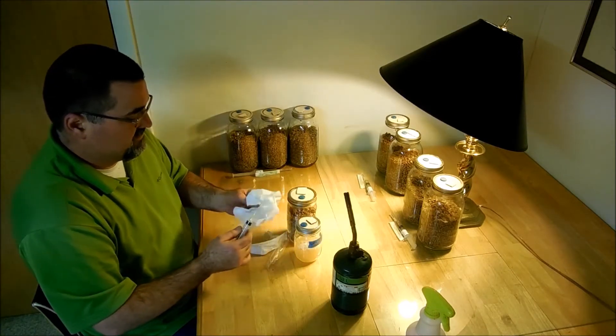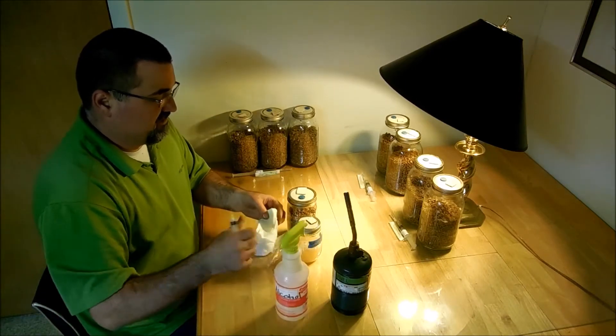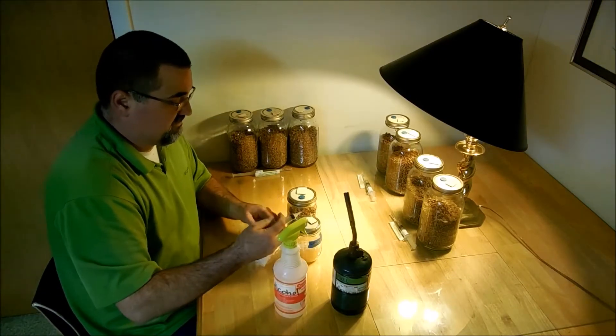So weird stuff did come off of that there. And then just a little bit of rubbing alcohol here. I know the rubbing alcohol is going to sterilize it.